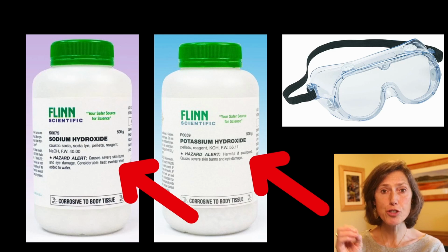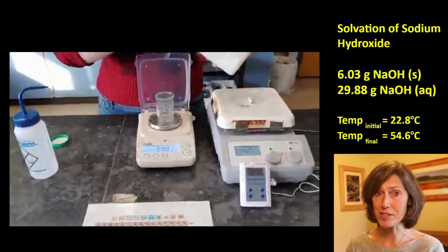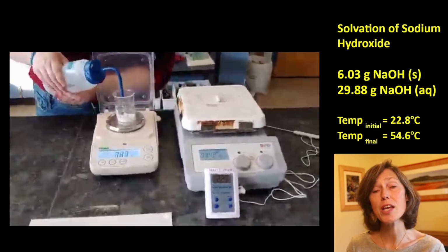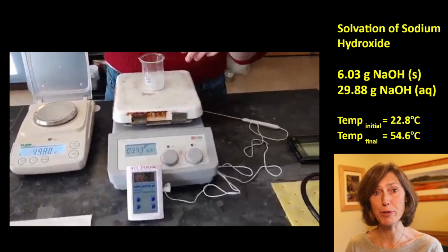Wearing goggles is thus very prudent. But having each student in the class look at these bottles, holding them in their hands, unopened, and check out the hazard alert label, it puts the ownership a little bit more on the student as to what safety precautions should be taken when handling these chemicals. So the idea behind lesson 6 is for students to dissolve a small amount of each of the 4 different ionic compounds in a set amount of water and observe the temperature change.